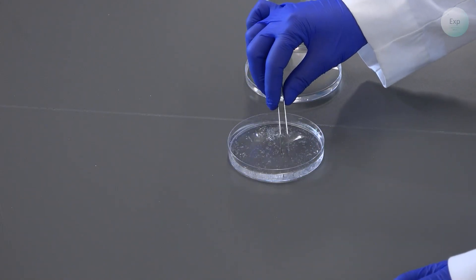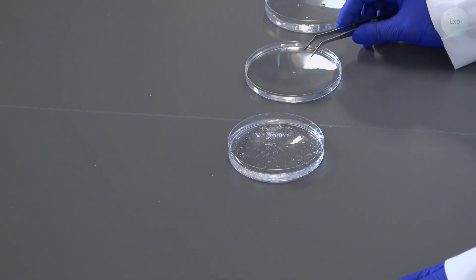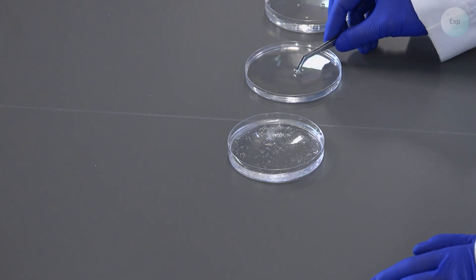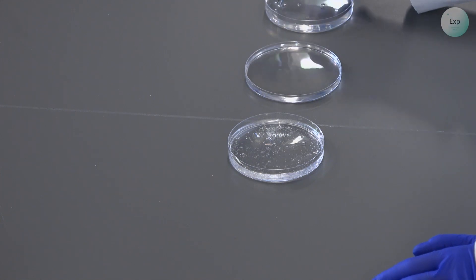If your crystal is large but seems like a twin, which means that two crystals seem to grow on top of each other, it's best to discard those crystals at this stage.